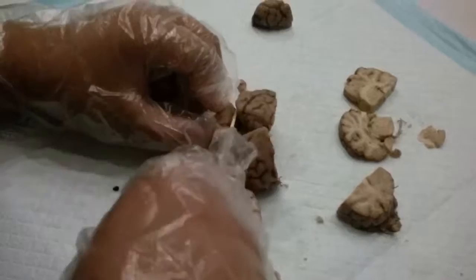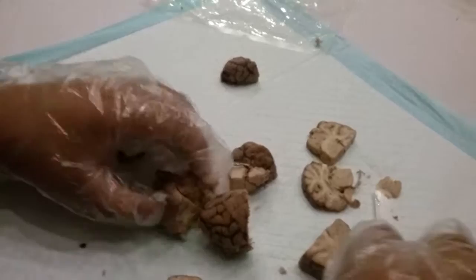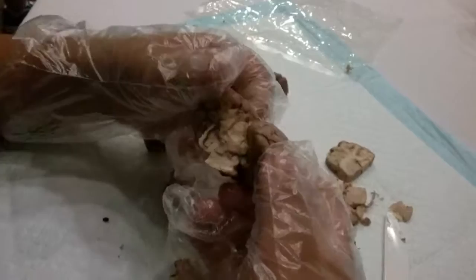What I want you to see here is there's a little hole at the top — this is how the brain fluid gets from the third ventricle to the fourth ventricle. That's a common site of blockage in humans, and we often have to treat people who have that blockage.